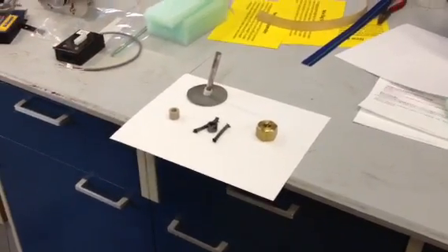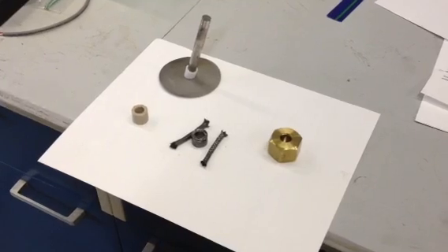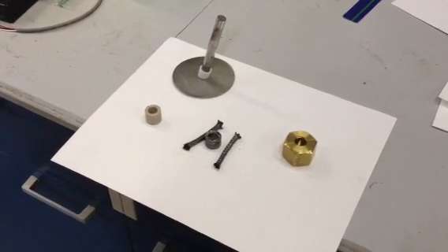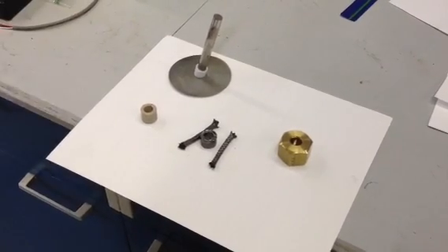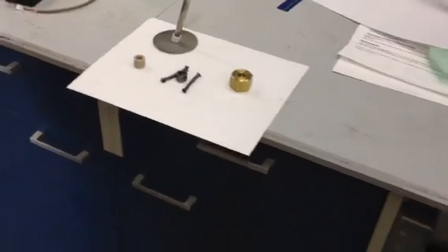Basically when you order a new packing set, it's part F28, and these are the components that will come to add a whole new packing agitator, packing nut, and PEEK bushing when you replace everything. And this is what I recommend if you've had any leakage. Probably good to have an F28, I would say, in spare parts.